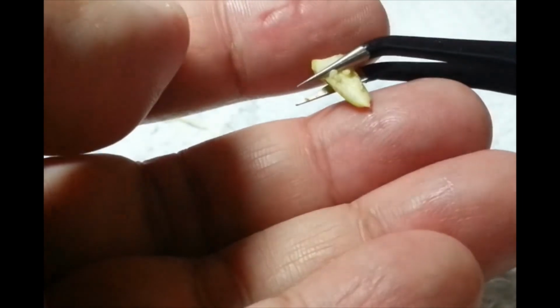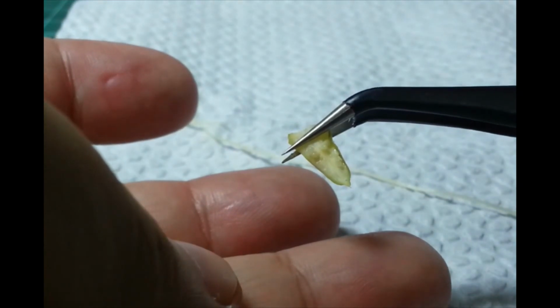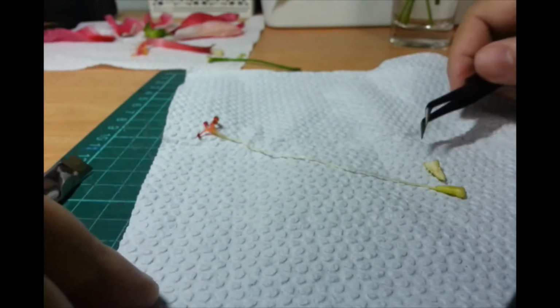Okay, so this is the ovary. Okay, or half of the ovary. It's better to see now. Okay, so you see the ovules there inside the ovary. Again, we have place it here where I got it. Zoom back out. Okay. So, ito yung half niya, diba?